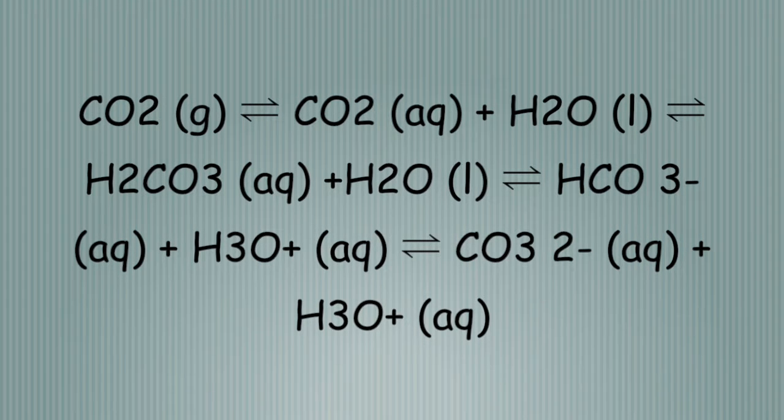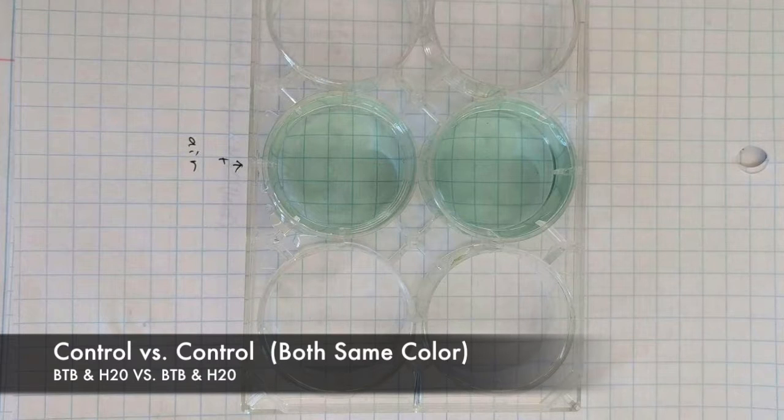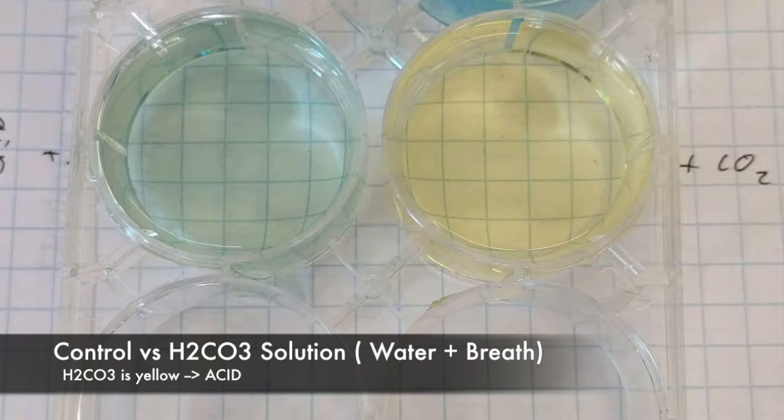Another way that we stress the system was by breathing into the solution using a syringe. By breathing, we produce carbon dioxide, which is then put into the solution via the syringe and reacts with water, which produces carbonic acid. BTB's most common use is to measure the presence of carbonic acid in a solution. This reaction can be expressed by this equation shown on the screen. As can be seen, hydronium ions are produced in this reaction. Thus, when carbonic acid is present, the solution is acidic and the color of the indicator becomes yellow.